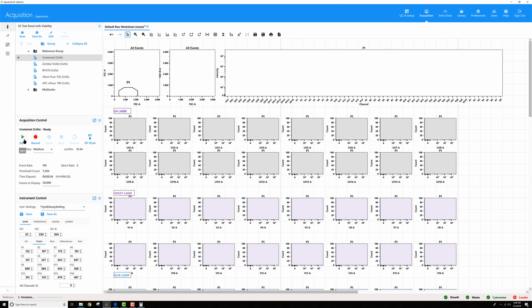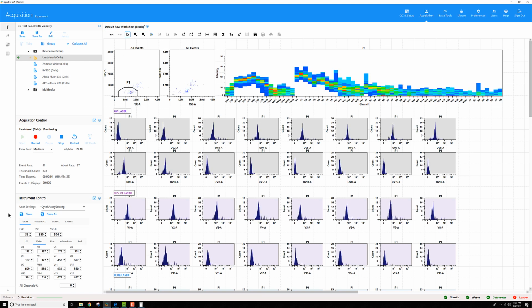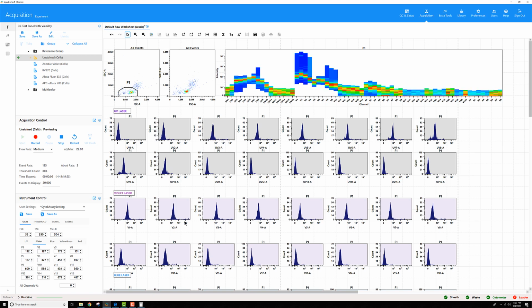Now let's preview those changes. Let the events build up. V1 looks good. V2 is right at the edge. I might still want to go a little bit lower. But everybody else looks great. So if I want, I could go down another, maybe 5 to 10% to make sure this V2 doesn't go off scale. It's kind of right at the edge.